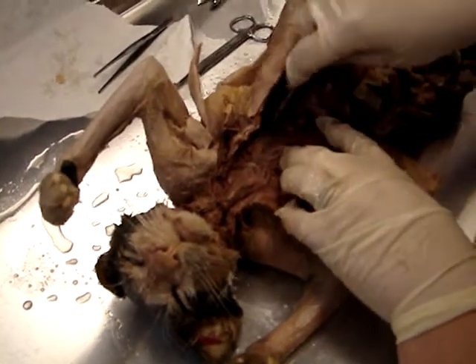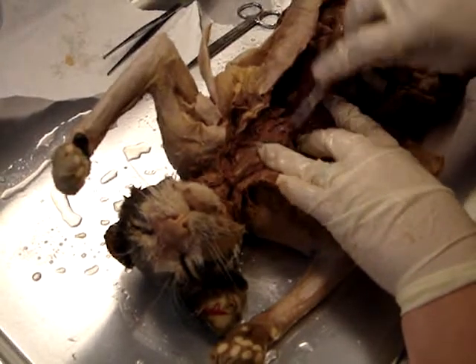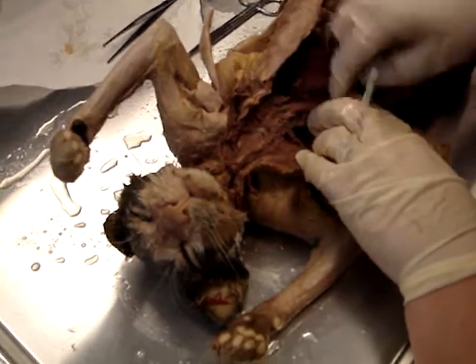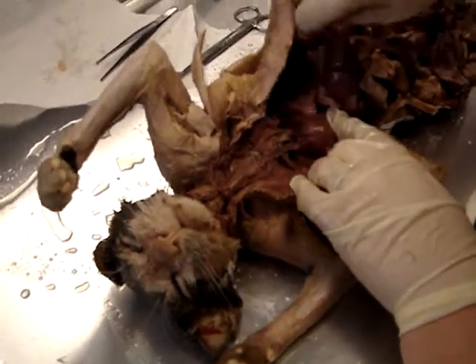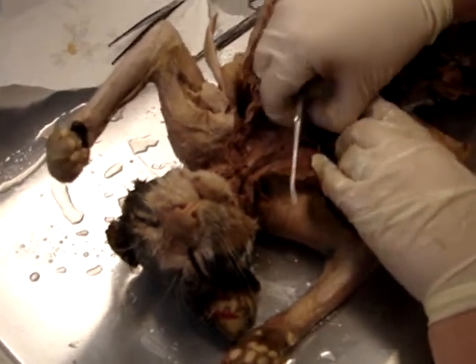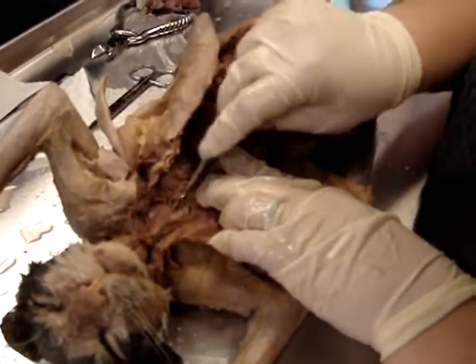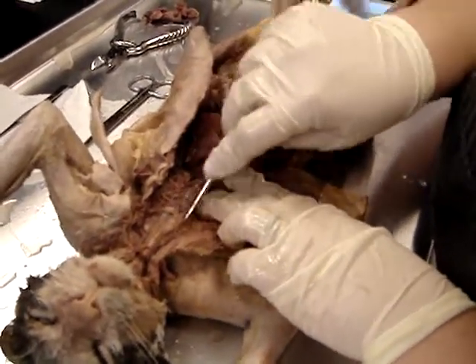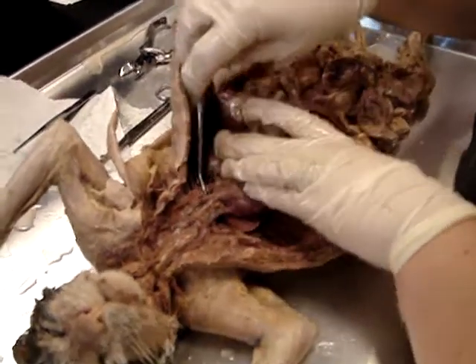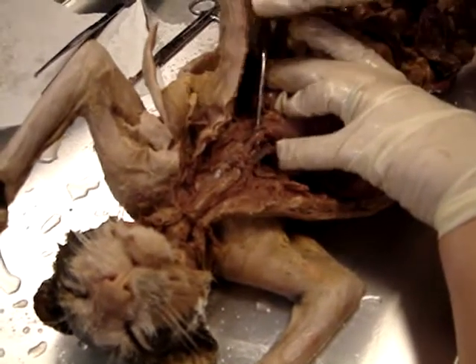And so coming off of the top of the heart, we are going to see, oh, this is good because this is very different from the other one. You're going to see two major things. Hold on a minute. Okay, you're going to see two major arteries coming off of the top of the heart. Arteries are red or pink. Okay, so here's the two.